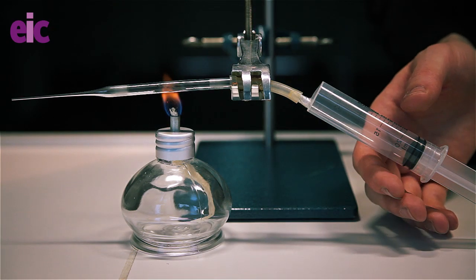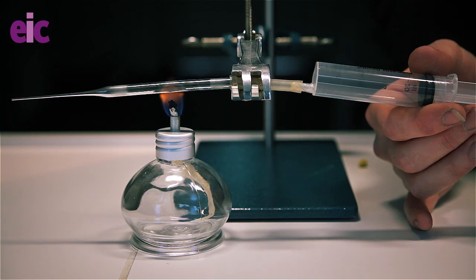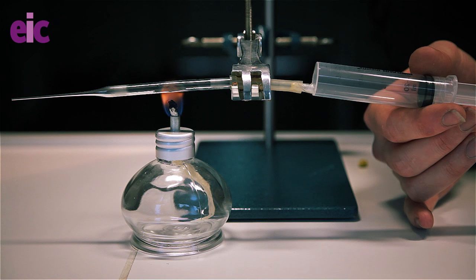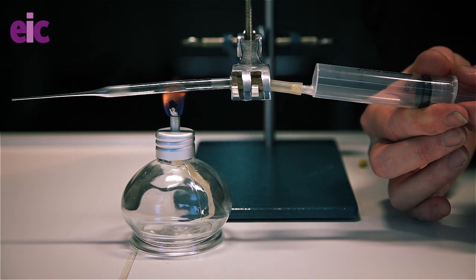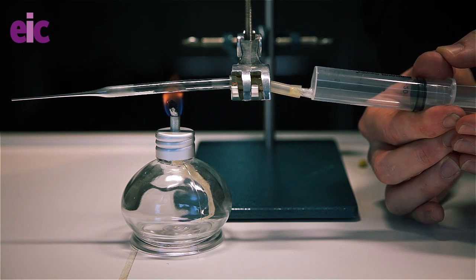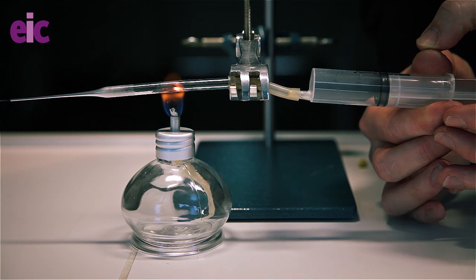So about two minutes have passed now, so I'm going to just gently pass the hydrogen over the top of the copper oxide. You should be able to see the glow of the exothermic reaction and also some water condensing in the end of the tube.